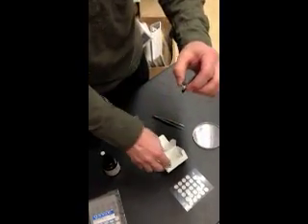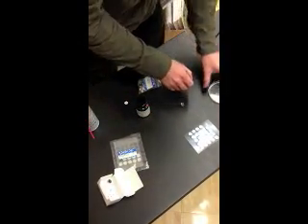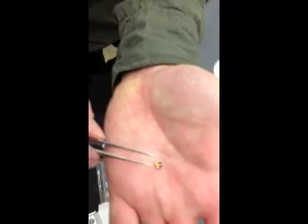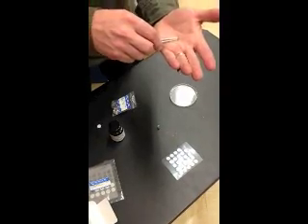While I'm waiting for prep, I'll set it into the tray here. And then I'm going to do another one. This one is the wet mount. So if you have a bigger item like an insect part — this is the eye pieces of a butterfly — you're going to want to probably use something more secure. You can first try the tape, but if the tape doesn't work and it blows off, then you need to work with something a little stronger. So I'll take another stub.